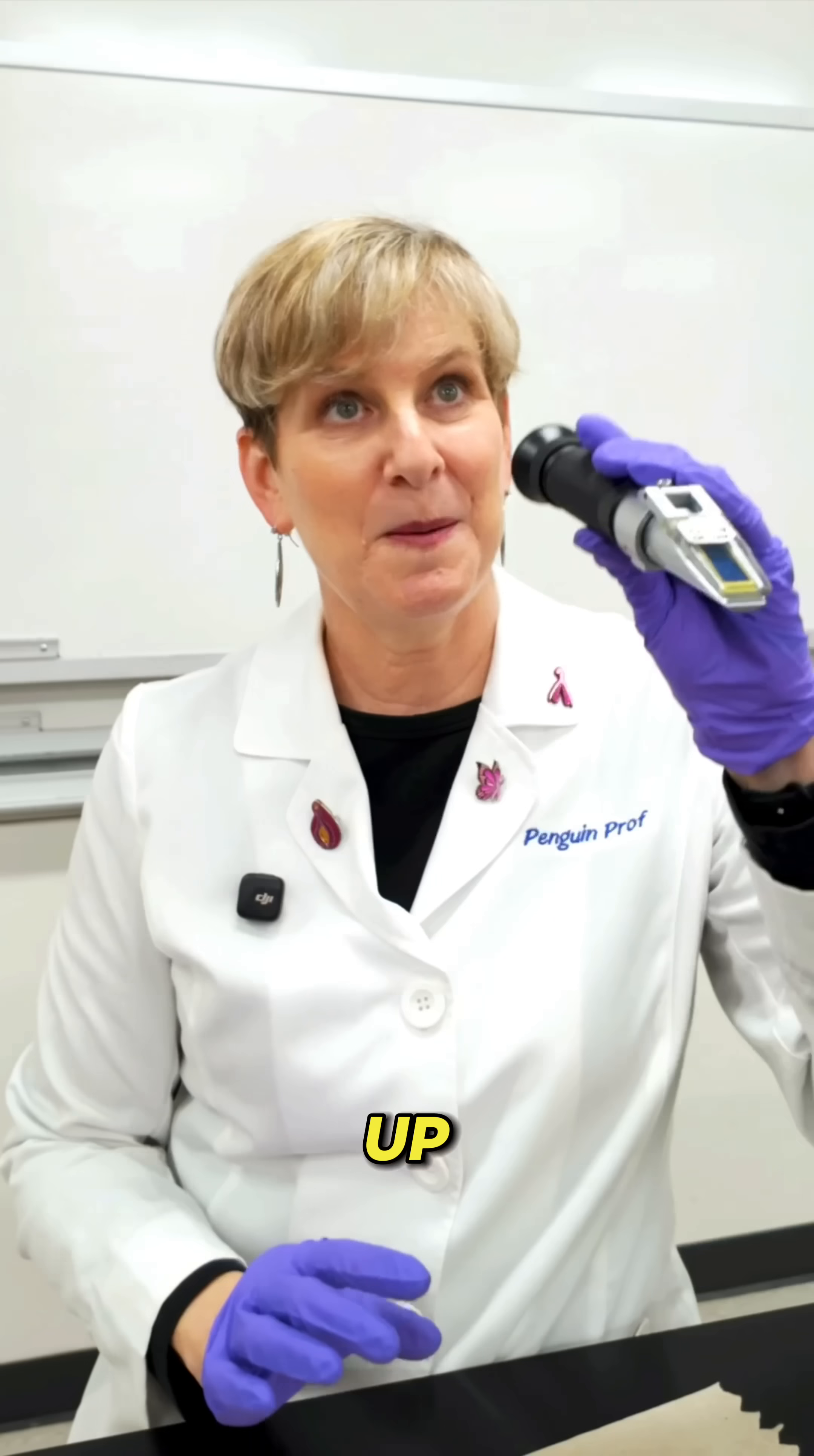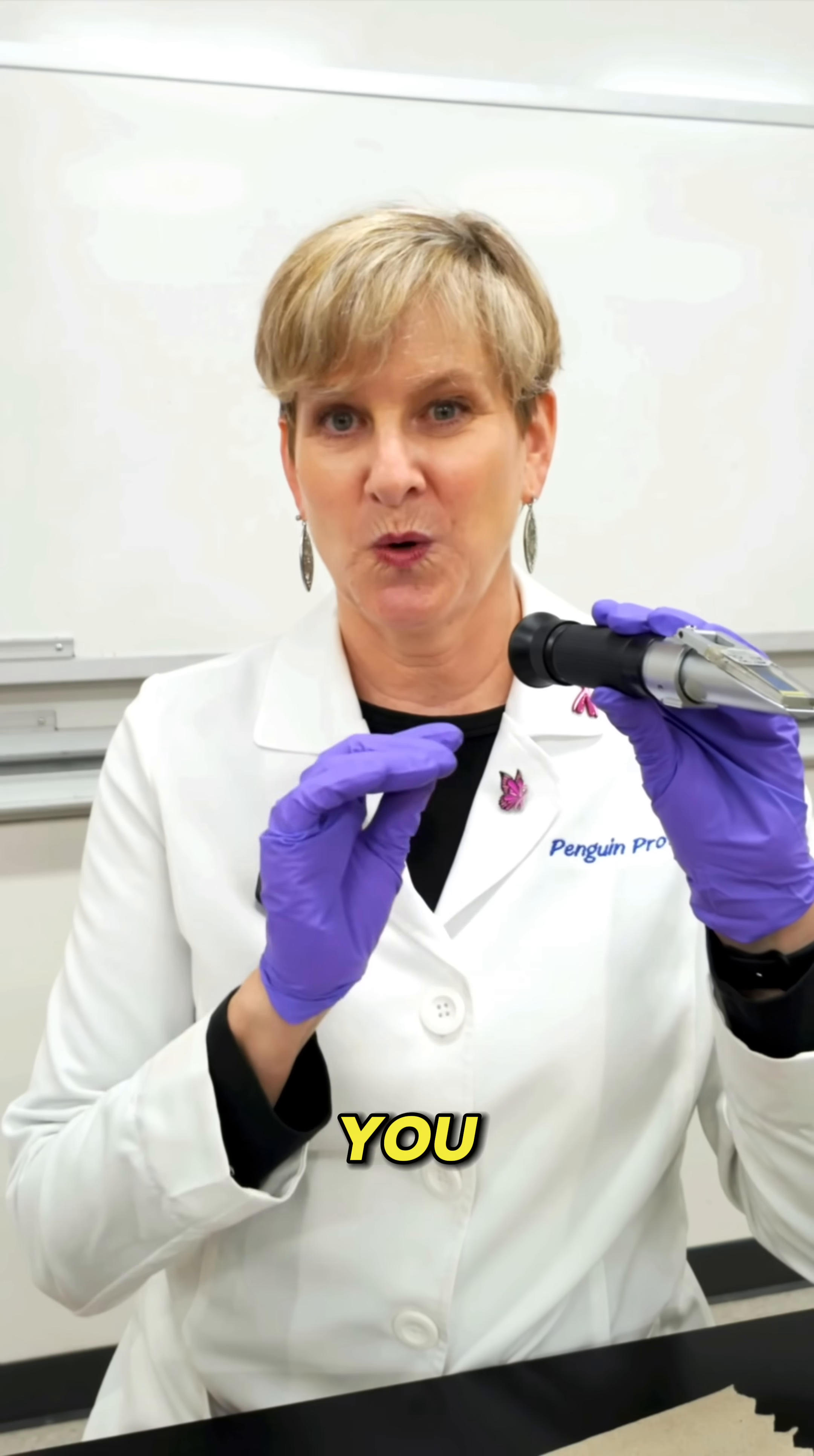And now look up at a light source. There are different models of these so make sure you have a manual and you know which scale you are reading.